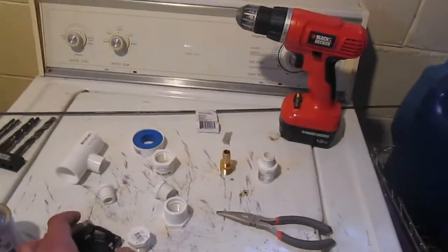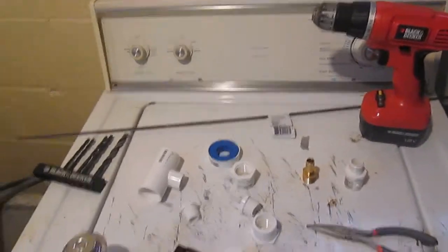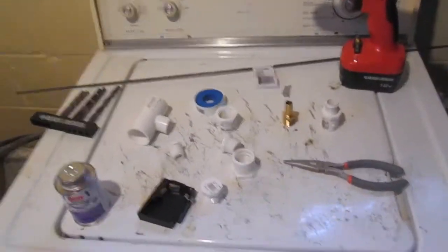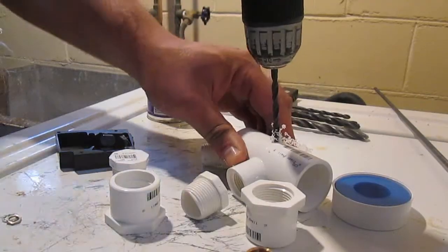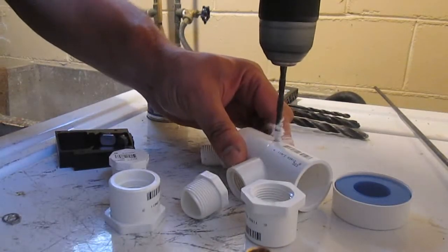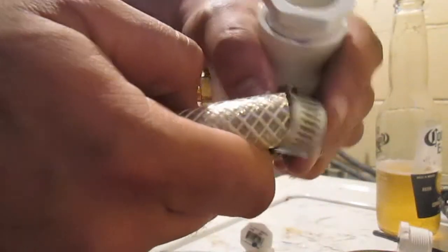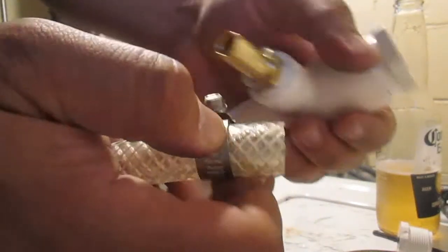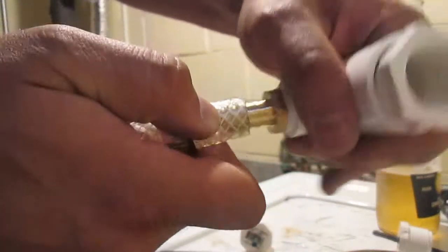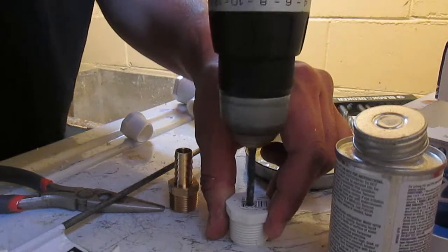I thought I'd make an emission spectrometer. So this is not too complicated. All we need is a chamber under vacuum with a couple of electrodes sticking into it and viewports to see what essentially is a plasma created inside.